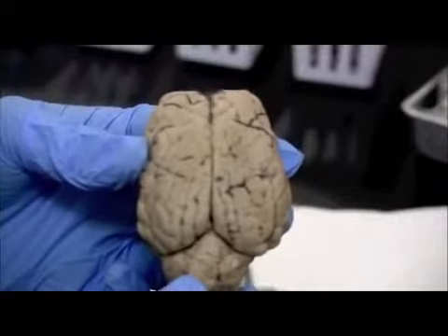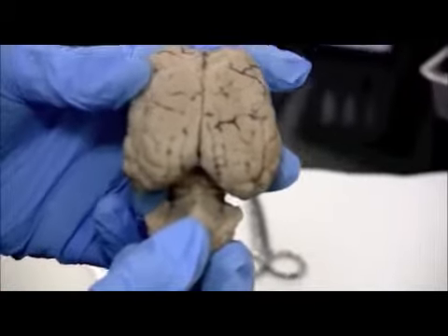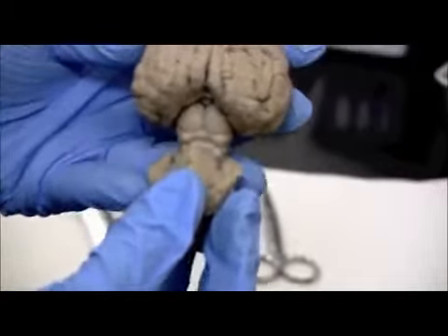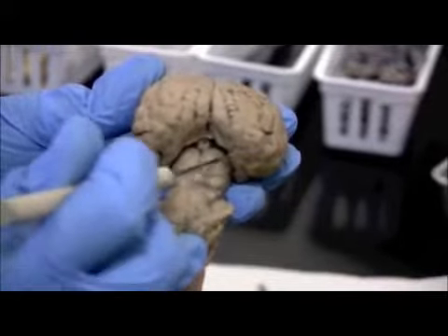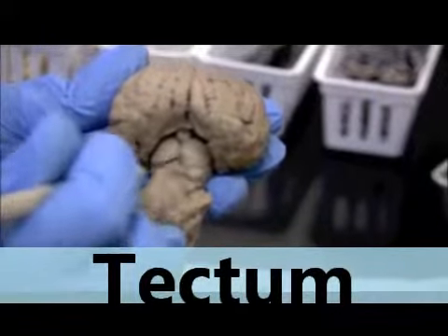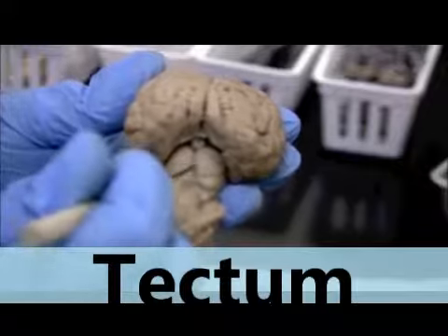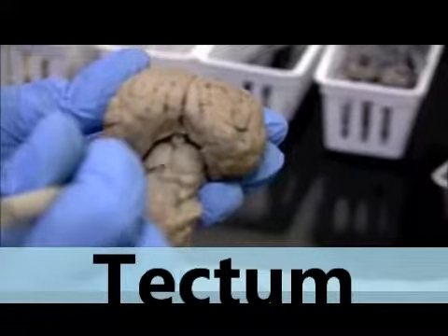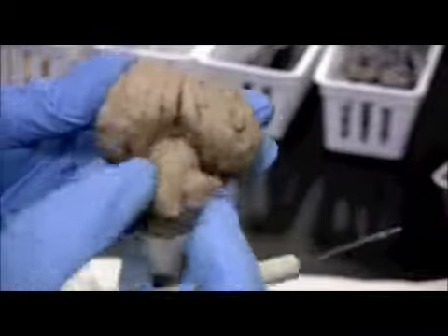Okay, and we're back on the superior side of the brain. Just want to show you what happens when we kind of pull back and separate the cerebellum. That's not a natural thing. You actually have to do that on purpose. If you look inside here, we have 4 bumps that you can see right here. This is part of the mesencephalon, the middle brain, midbrain. These are the superior colliculi, and below it would be the inferior colliculi. So 2 pairs of colliculi together, those 4 bumps make up the corpora quadrigemina. And that's one of the main portions of the midbrain, or mesencephalon. It's on the posterior side. You actually have to pull back the cerebellum.